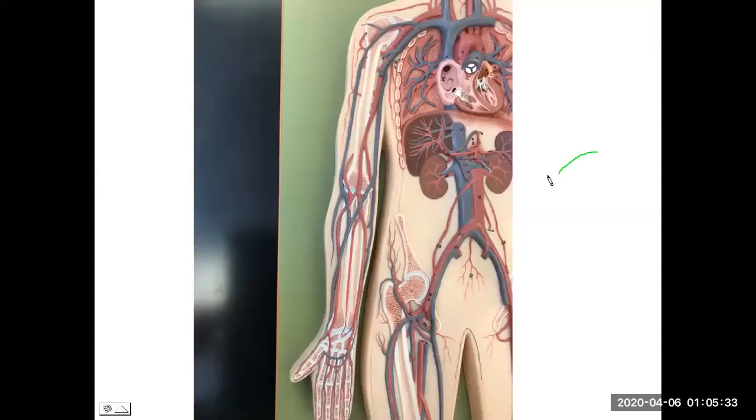All right, so here we are zoomed in. Now you notice a closer look at the thoracic and abdominal regions. So again, the large artery is that abdominal aorta. So the abdominal portion of the aorta, again, inferior to the diaphragm.